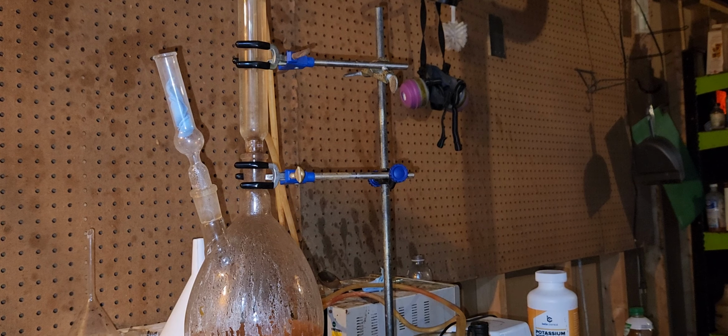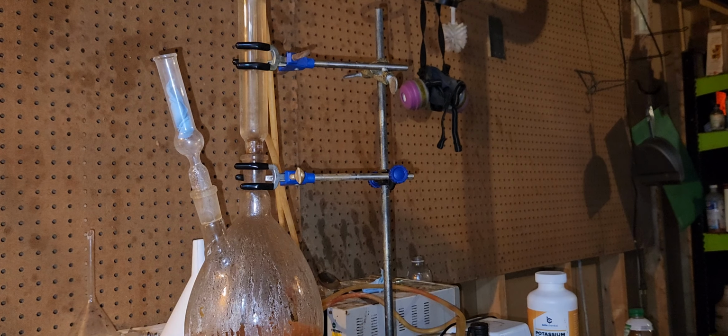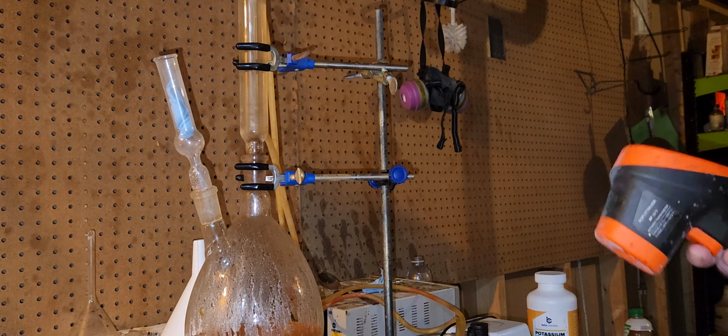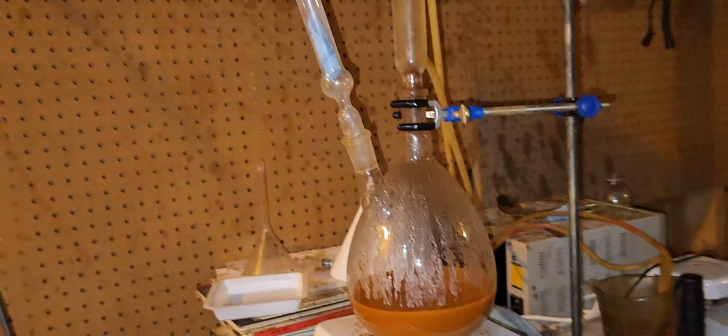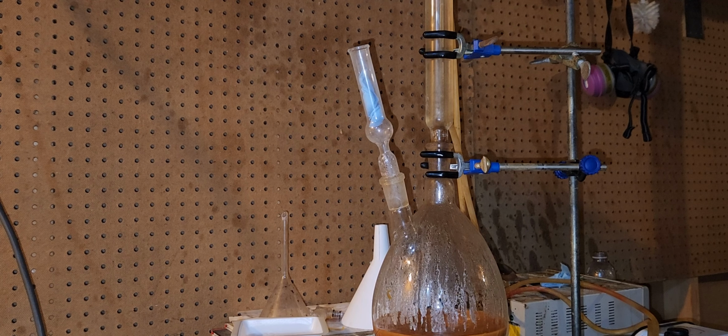I've been troubleshooting the vanadium pentoxide, 20 grams in lye. I did some more research, and you have to heat the solution to about 100 degrees Celsius, and as you can see, it's hard to do with my hand, but it's about 100 degrees Celsius.